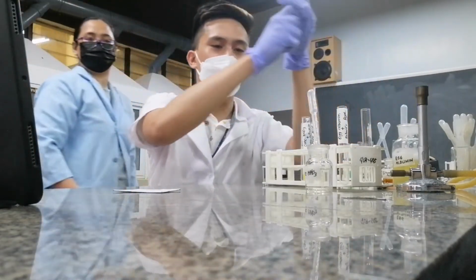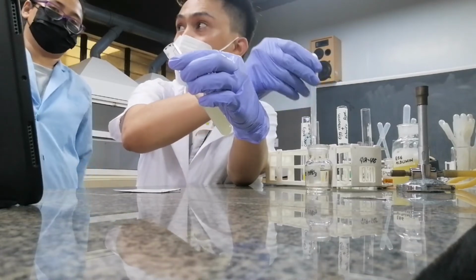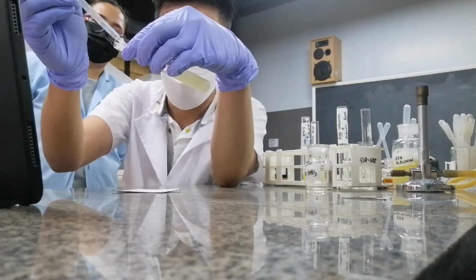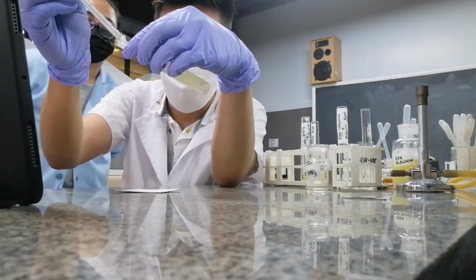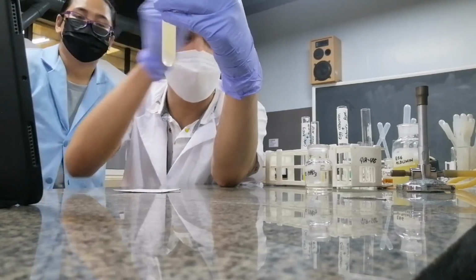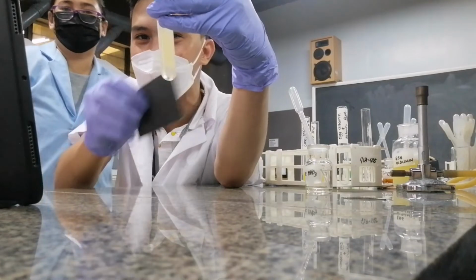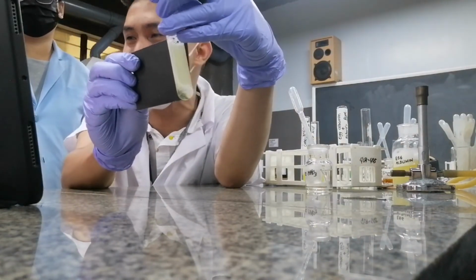Heller's test is used for low concentrations of proteins, ma'am, but this is highly concentrated. Okay? So it's not a ring actually. As you could see, it's a white stain.